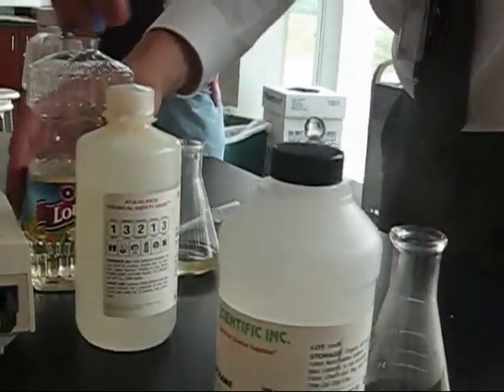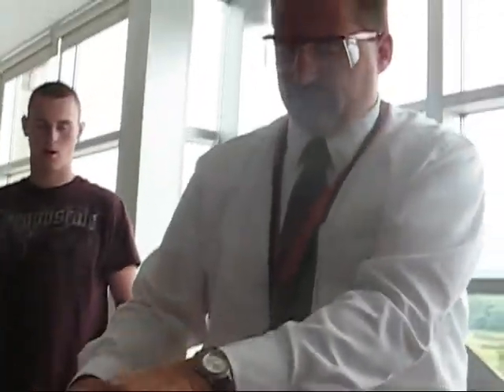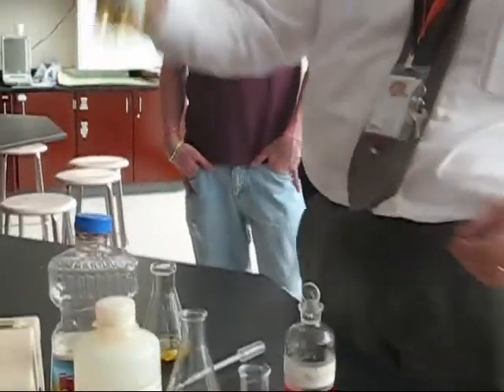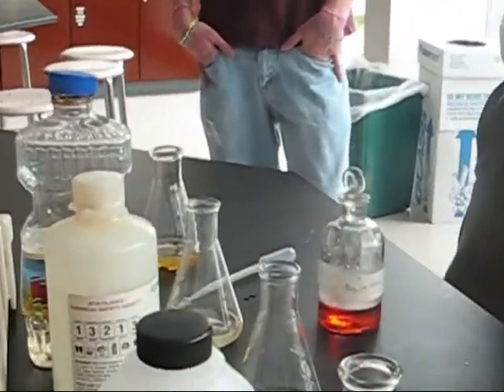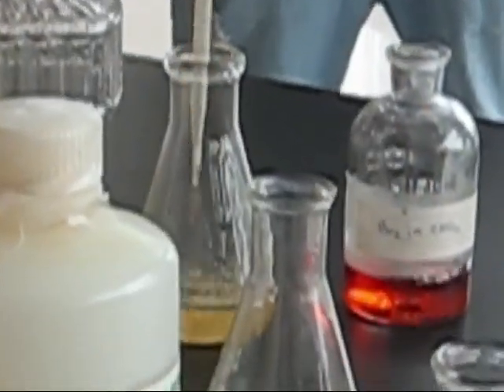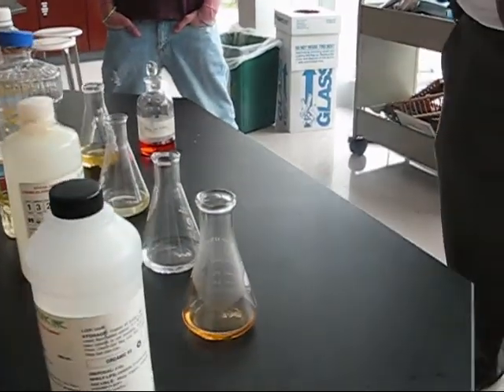Regular vegetable oil probably has some unsaturation in it too. Let's find out how much bromine this can eat up. This is the cheap stuff. It's probably a mixture of corn oil, soybean oils. Let's see. Nope, actually, it just says soybean. So is soybean oil unsaturated? Let's find out. Seems to just eat it up. So it's got to have some unsaturation too. Eventually you could probably maximize it, and then the red color would linger like this does. So question for you. Can you think of any fats that are saturated?